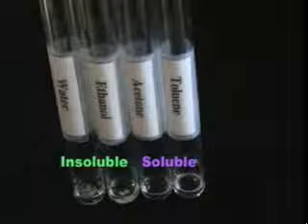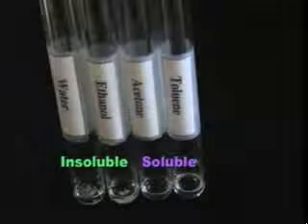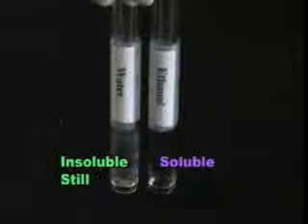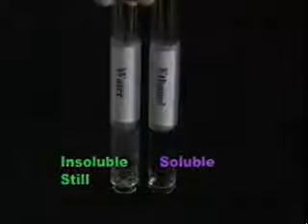Now that you have finished the solubility tests, how do you decide which solvent to use for your recrystallization? The ideal solvent is one in which your compound is insoluble at room temperature, but soluble at the boiling point. Remember, at room temperature, naphthalene was soluble in both toluene and acetone, so neither of these will work. After heating, naphthalene remained insoluble in water, even at the boiling point. This means that ethanol is the solvent of choice. It dissolves the sample at its boiling point, but not at room temperature.